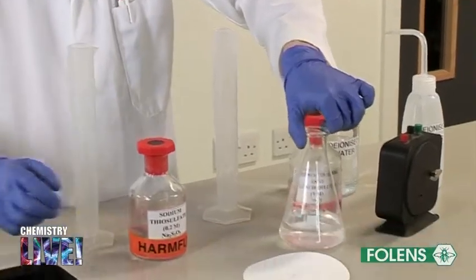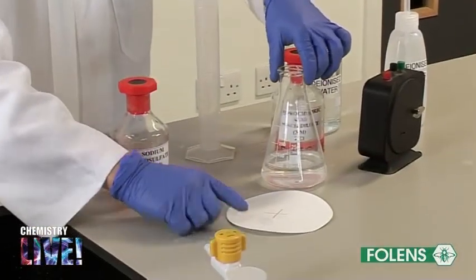Place the conical flask on a sheet of white paper on which a mark has been made.